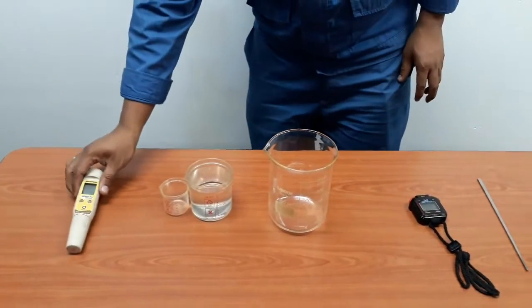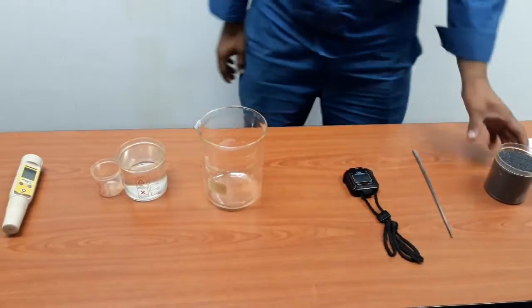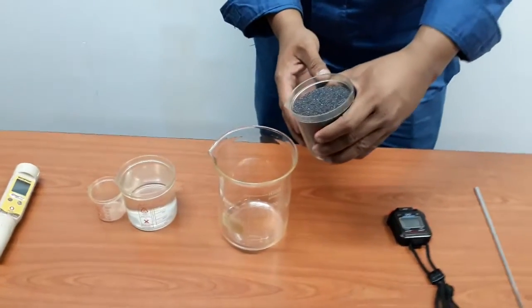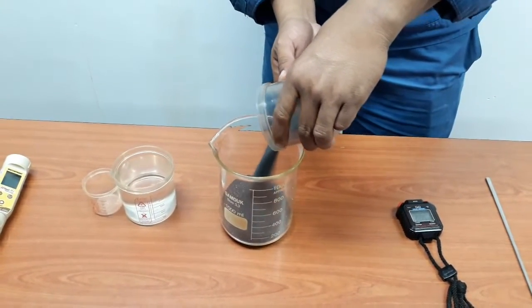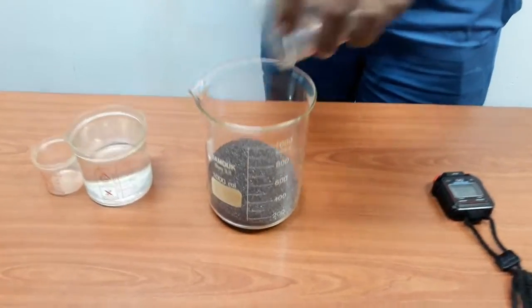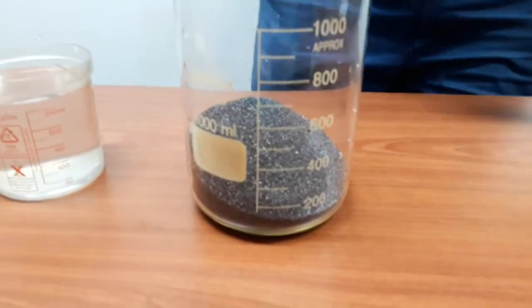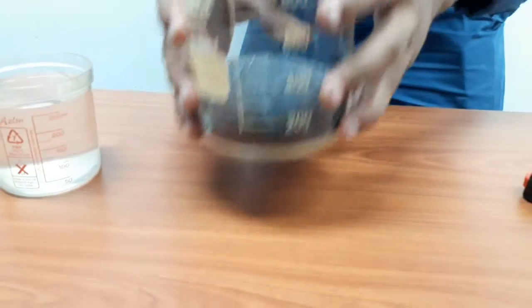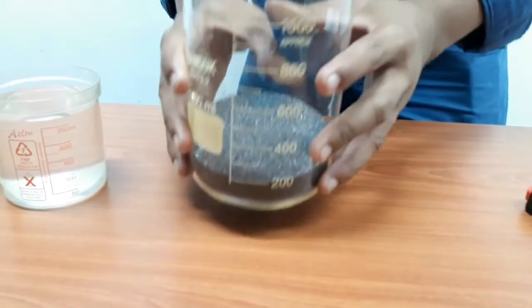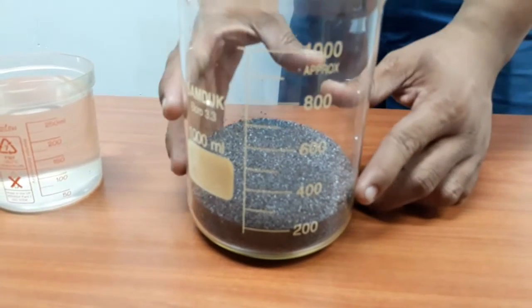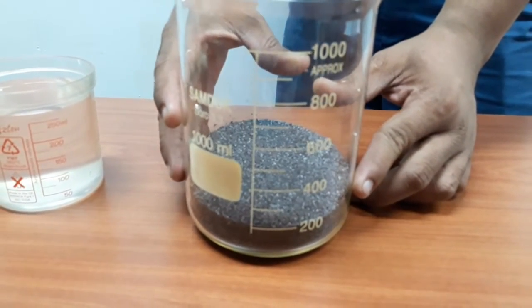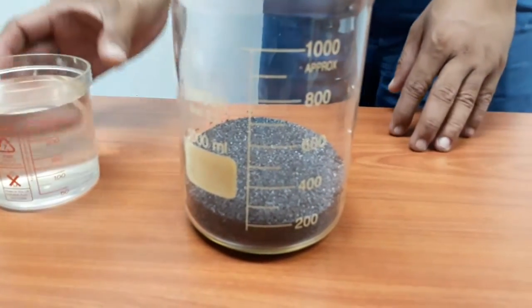Pour 300 ml of abrasives into the container and add 300 ml distilled water.